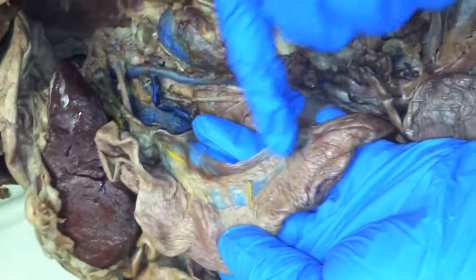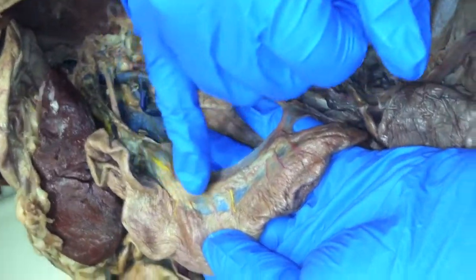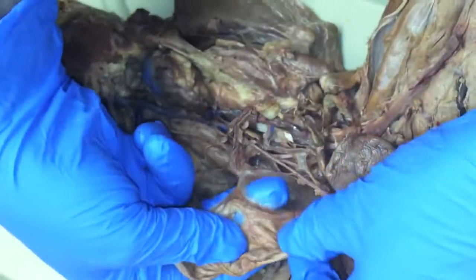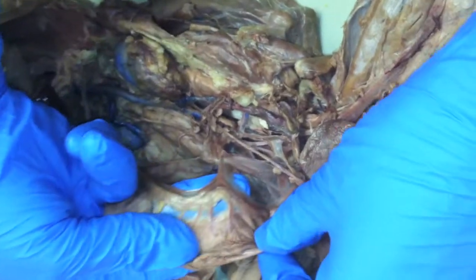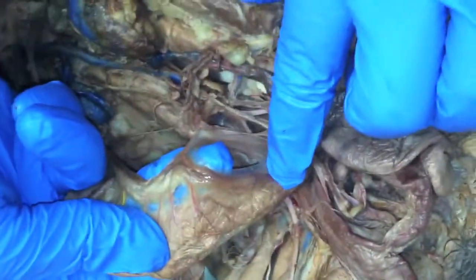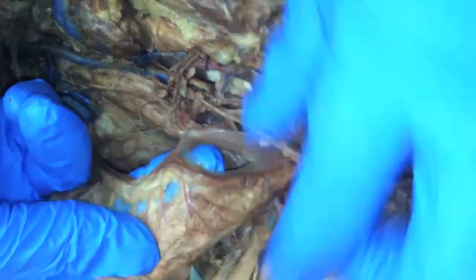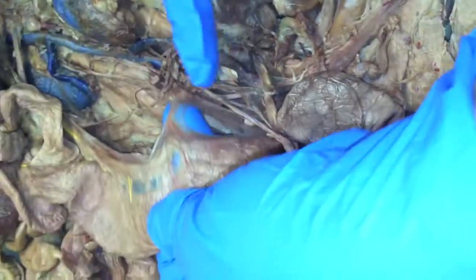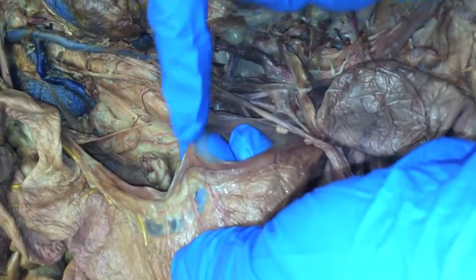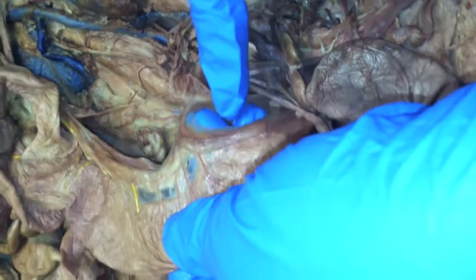This is all running along in there. That's left colic. Cranial hemorrhoidal is the same one heading on down. And the artery — cranial hemorrhoidal artery is cranial hemorrhoidal. You can see the artery right here, off the posterior mesenteric, or caudal mesenteric.